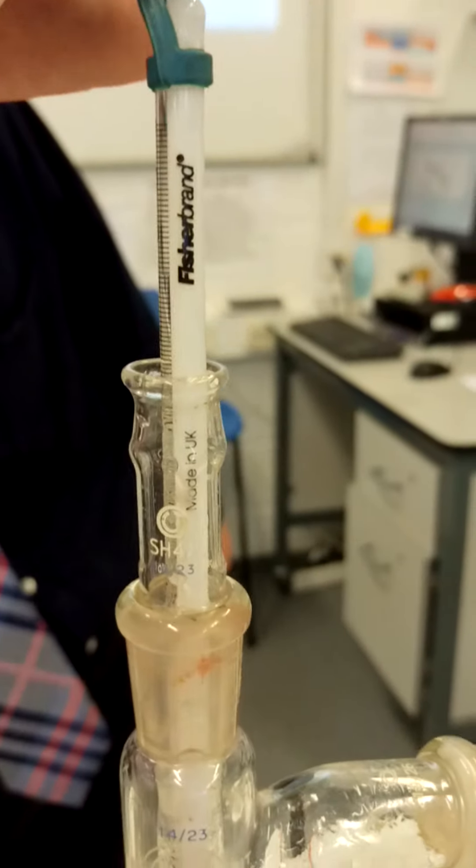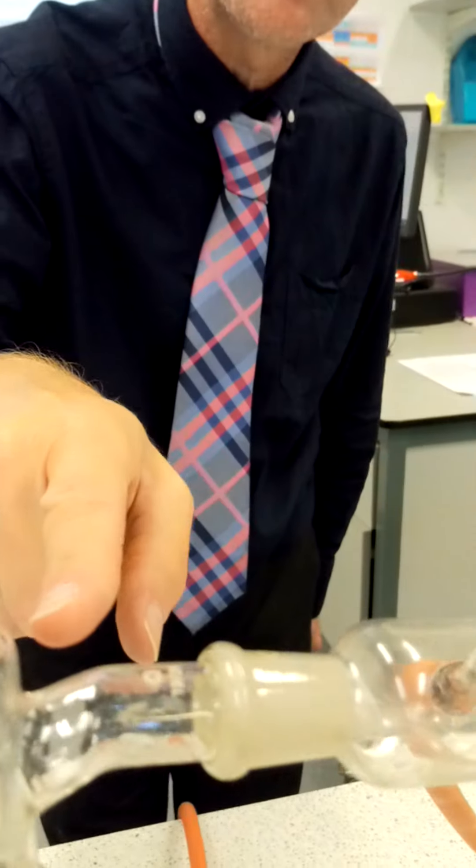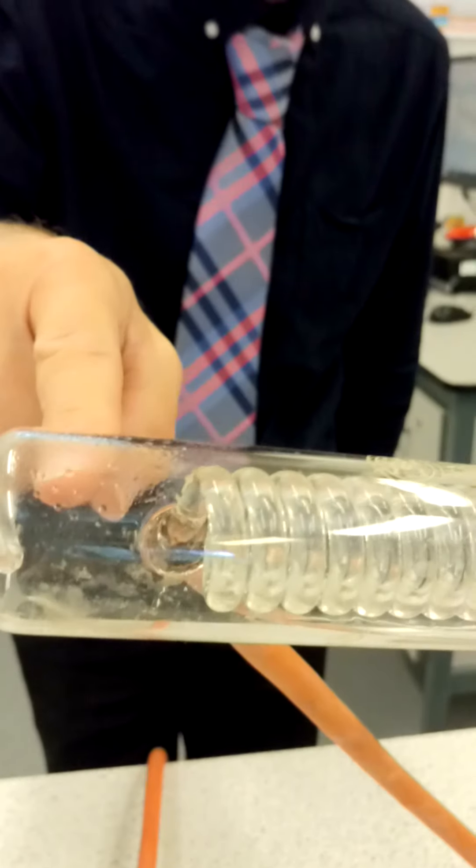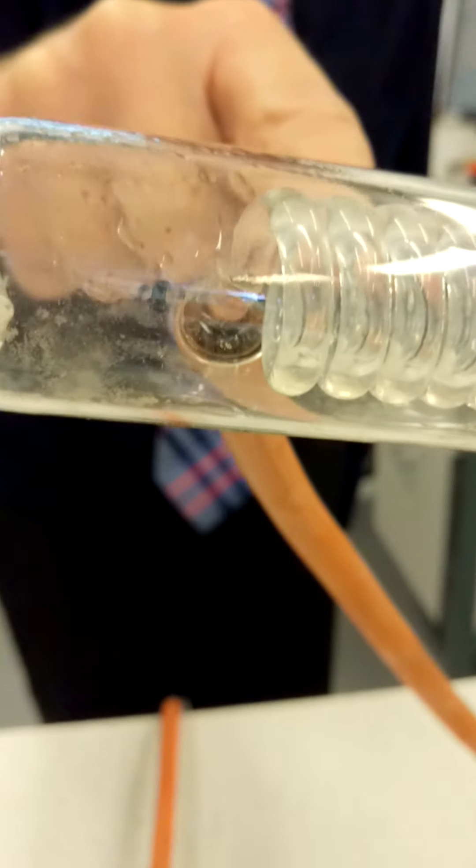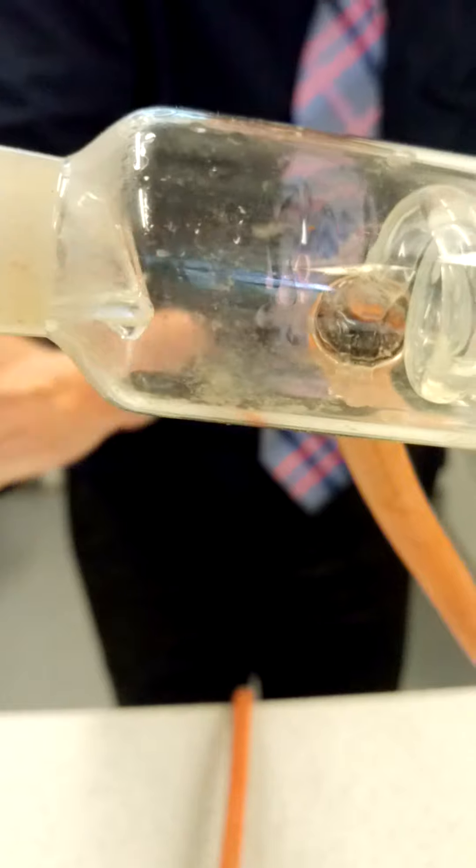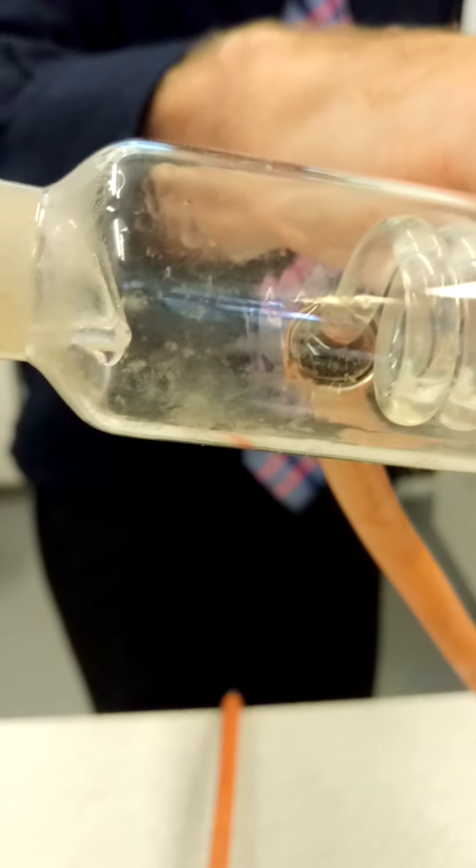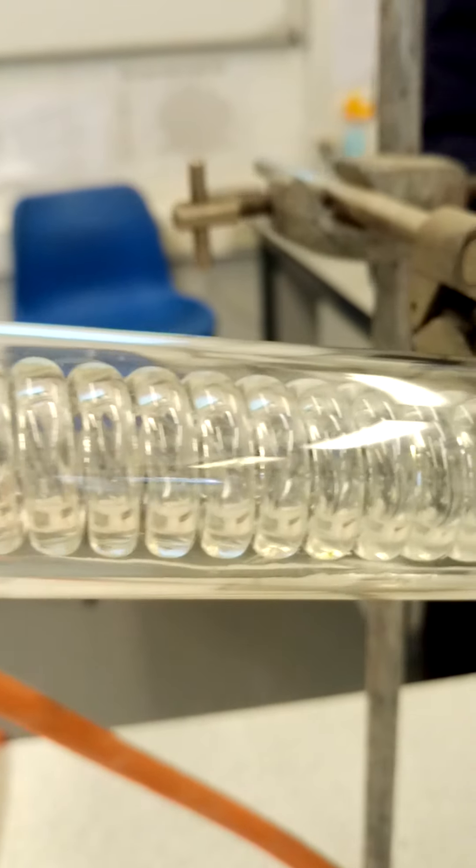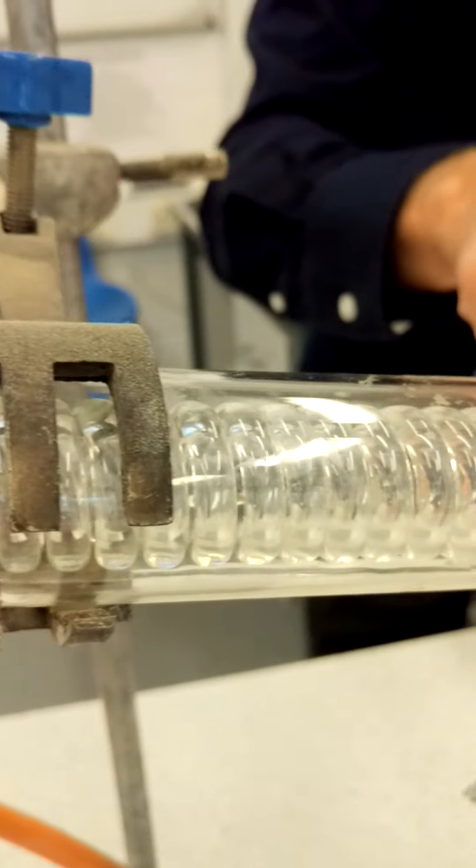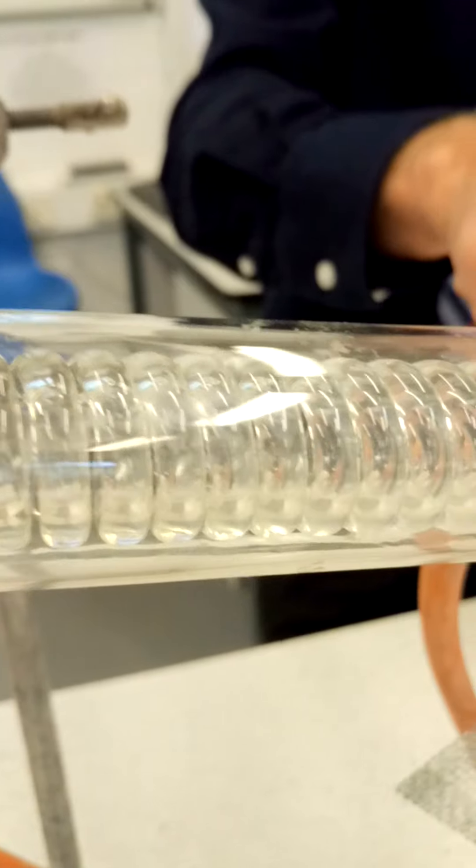And in fact, the temperature is now reached 55 degrees Celsius. And I think there is something here beginning to come down the condenser. Just check this. Yeah, this is really cold, which is great. That's boiling hot. This is still really cold. And here, it's running down the condenser, just past the spiral. And in a moment, I'm hoping we can collect some distillate.